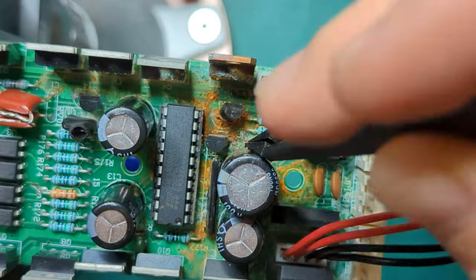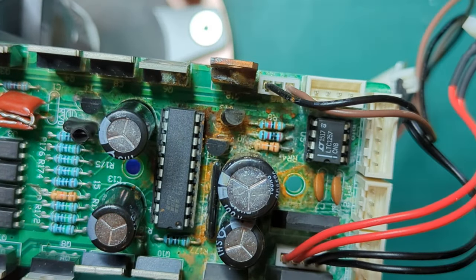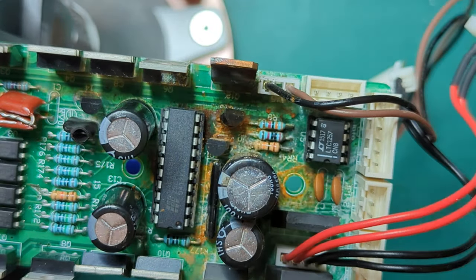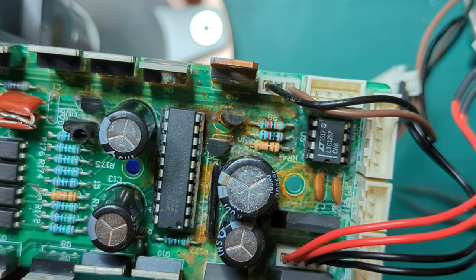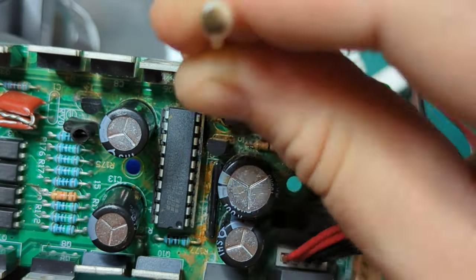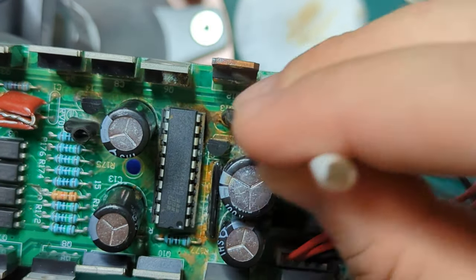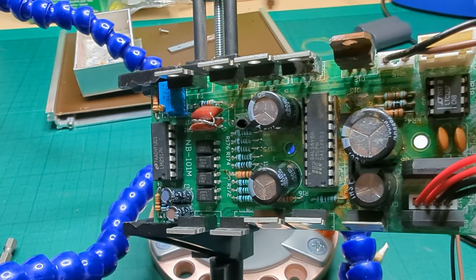Clearly, at some point in its life, some water's managed to drip through the casing and onto this board. I'm a bit surprised in a way that there isn't any cover over the top, but I guess it's a good warning to me in the future. If I spill anything or any drips get loose onto that case, I should clean them up straight away. Sometimes manufacturers coat electronics or cover them in a kind of epoxy resin to keep them waterproof, but I guess in this case it was either an expense too far or they just didn't think they needed it.